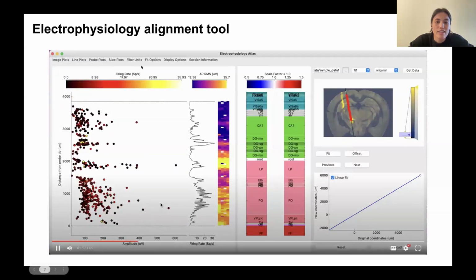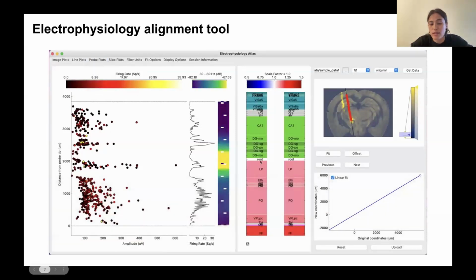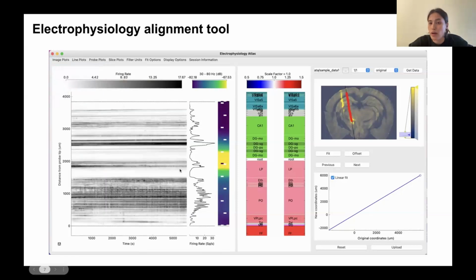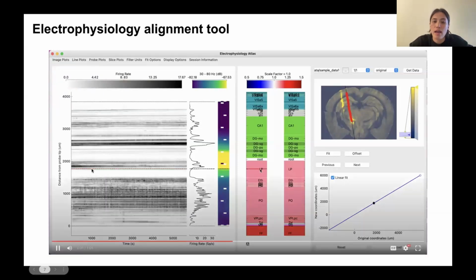You can also change the probe plots. So there are lots of drop-down menus that allow you to change the different plots that you display. And you can zoom in, for example, on displays to see things in more detail. So everything in this GUI is based on these reference lines that I was referring to earlier, and these can be added to the display by double-clicking. And you get a pair of lines that move independently on the electrophysiology and also the histology image.